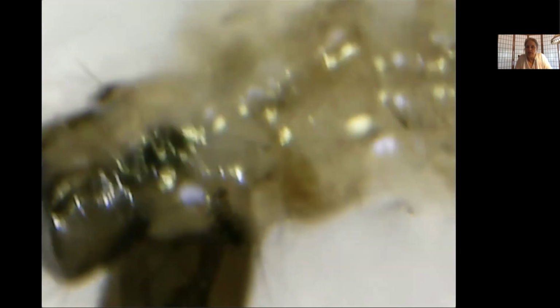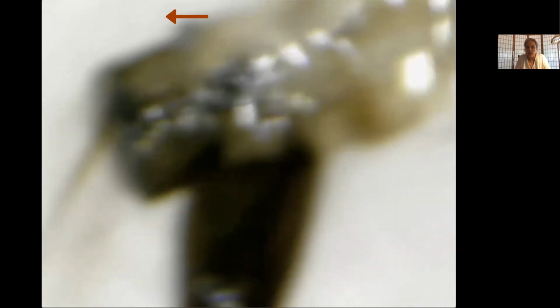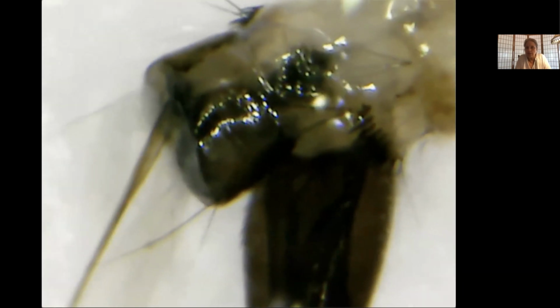And finally, if I can just move this over carefully. There we go. Okay, back there. You can see in this line up here too, that you can see very clearly those comb scales that we identified earlier. Here they are located right above the siphon again, but you can only see a few of them because of the way that this is oriented. But you can see that these particular guys, they come to a point. There we go. All right, good.